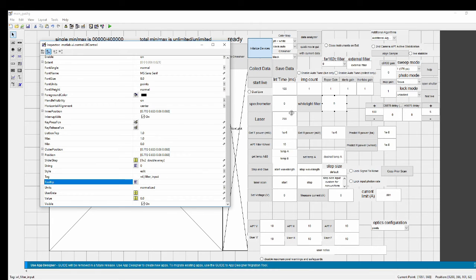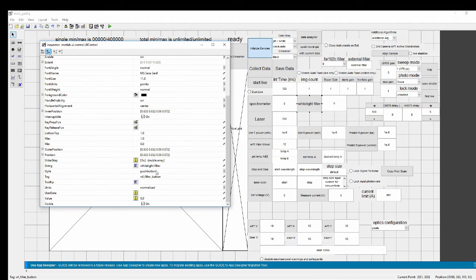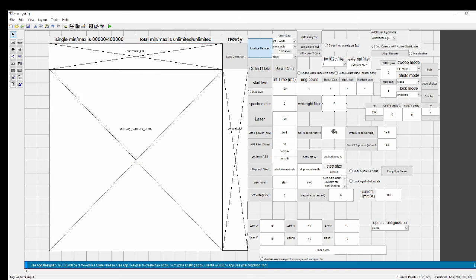And by default, we have it set to 0, which would be a full pass-through of all wavelengths, because it's 0th order imaging at that point. And did I actually type it out? No, I abbreviated. Good. That's what I wanted. Check this just to be sure. Okay, good. So now we hit Control Save on here.